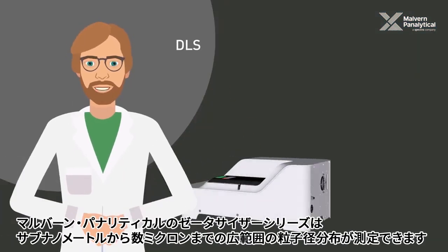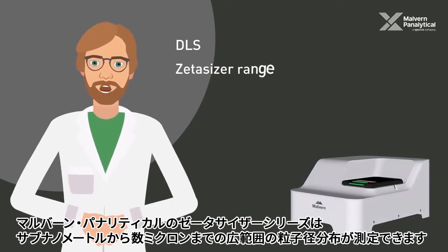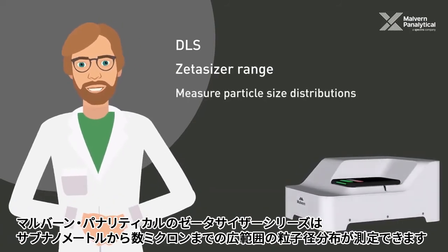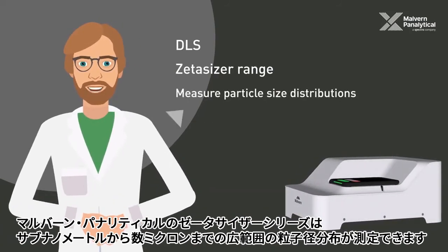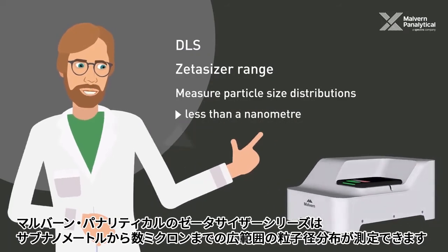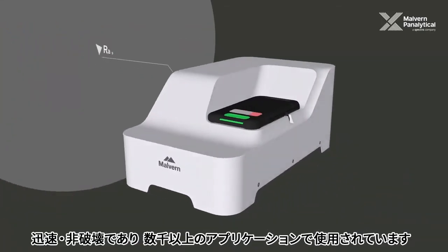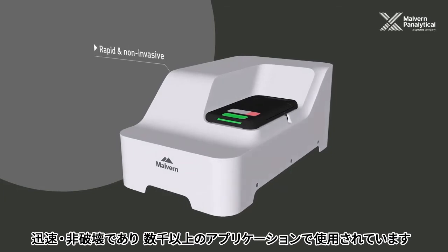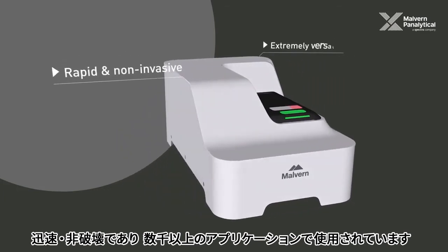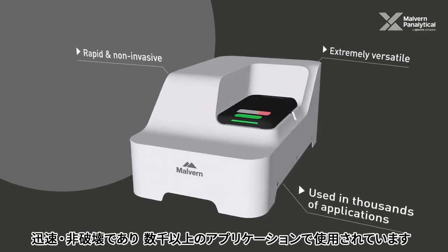DLS, as used in Malvern Panalytical's Zeta Sizer range, can measure particle size distributions ranging from less than a nanometer up to several microns in size. It's a rapid and non-invasive technique, which is extremely versatile and used in thousands of applications.